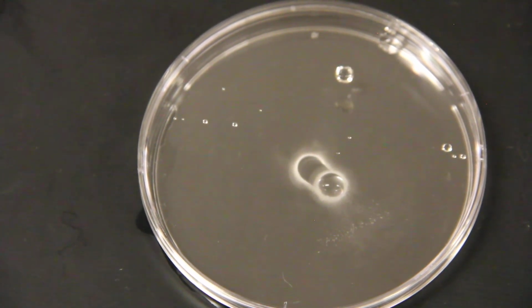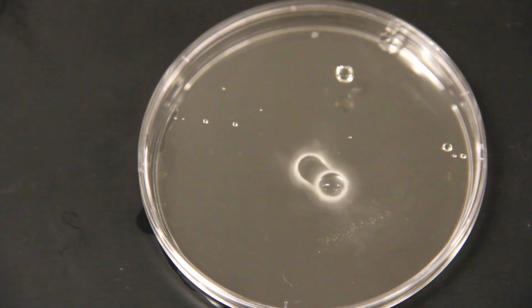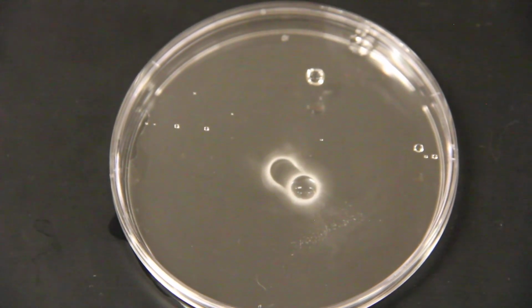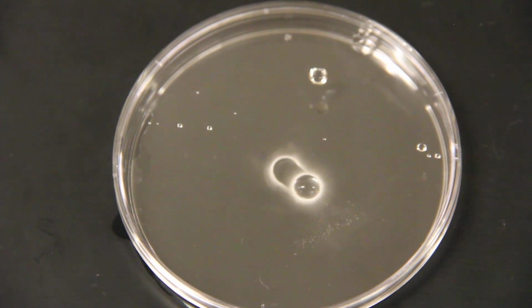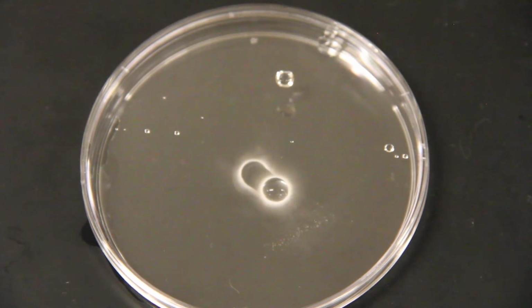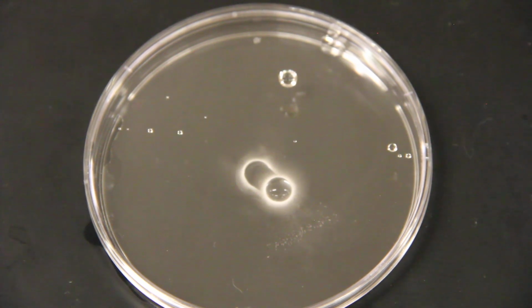So that's your product when you took the HCl plus the NH4OH, and those vapors combine with each other and you end up with a synthesis reaction. Because the NH4 that is part of the ammonia combines with the HCl and makes a compound called ammonium chloride.